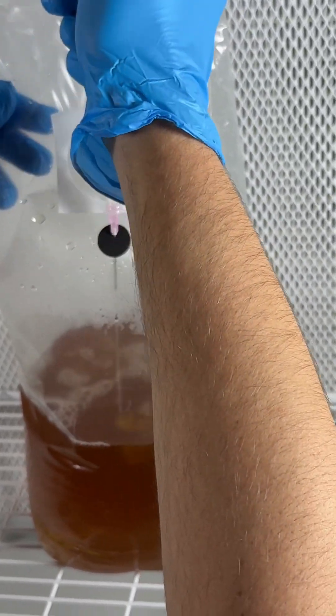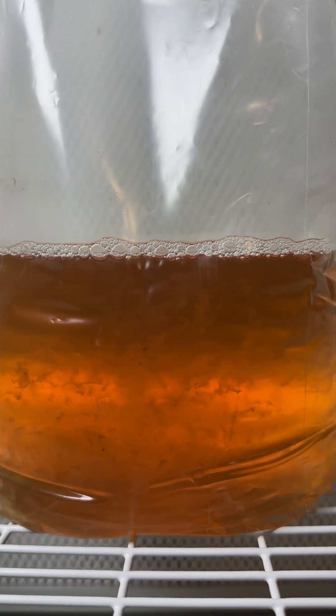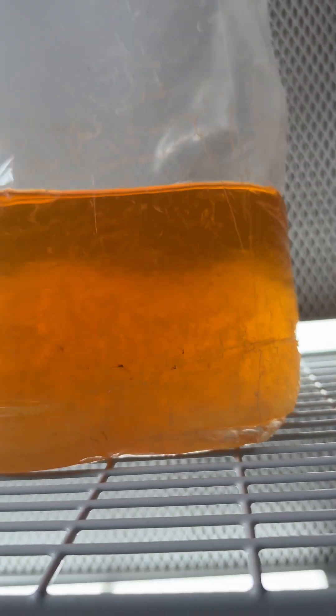Now I just put the bag of liquid culture on a shelf in a warm room and agitate it every day, and then the mycelium will keep growing more and more until it's completely full.